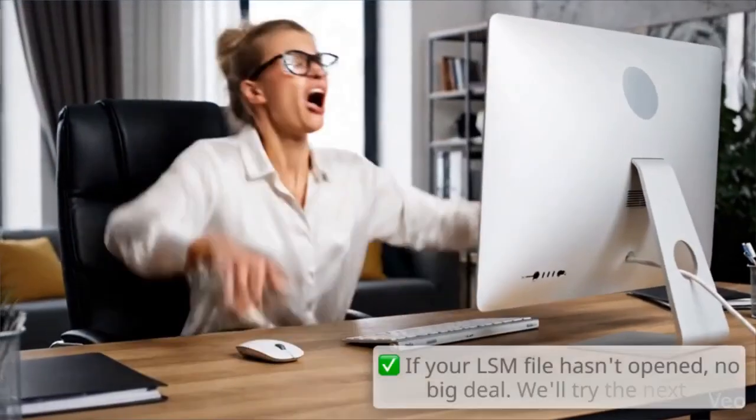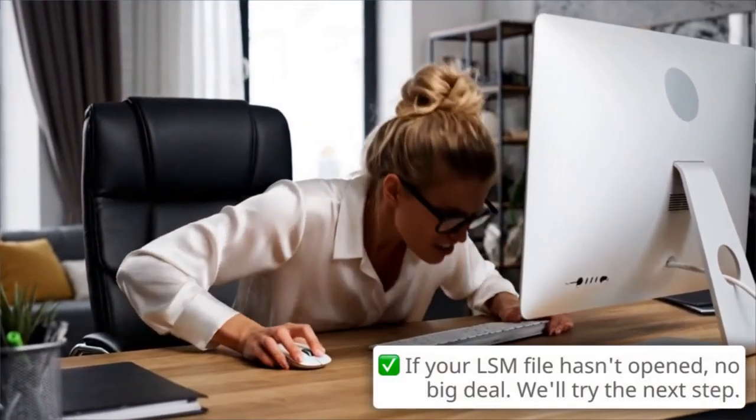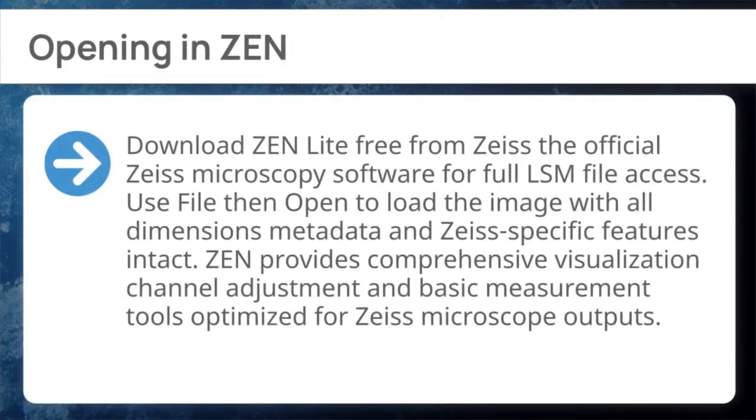Before we jump to the universal solution, let's look at the specific reasons this LSM file is failing to load. First, opening in Zen. Download Zen Lite free from Zeiss, the official Zeiss microscopy software, for full LSM file access. Use File, then Open to load the image with all dimensions, metadata, and Zeiss-specific features intact. Zen provides comprehensive visualization, channel adjustment, and basic measurement tools optimized for Zeiss microscope outputs.